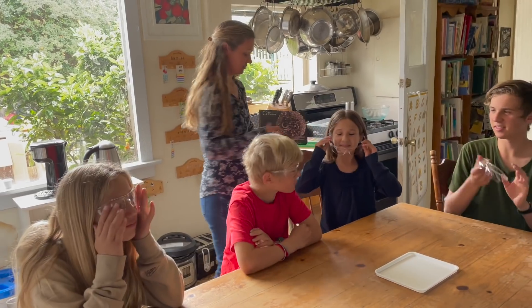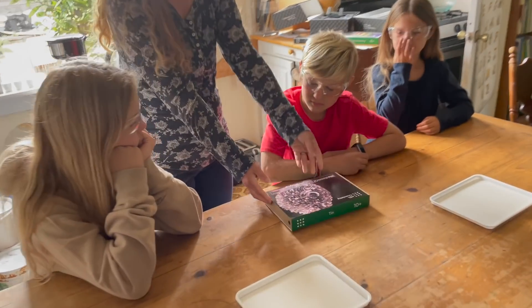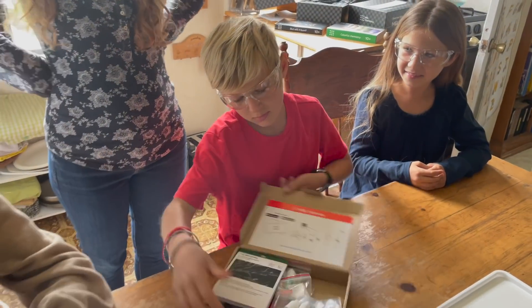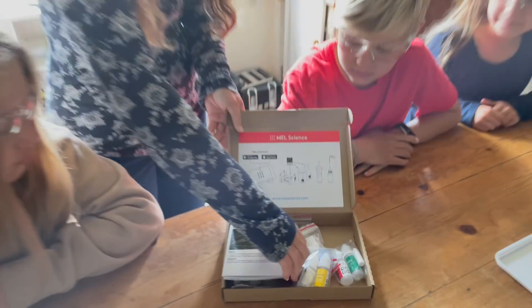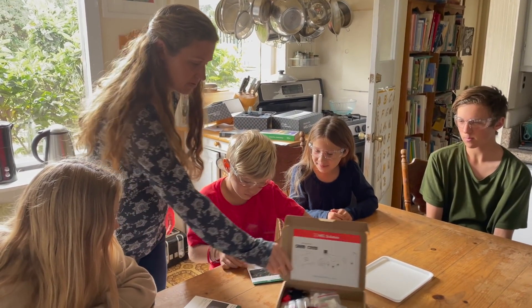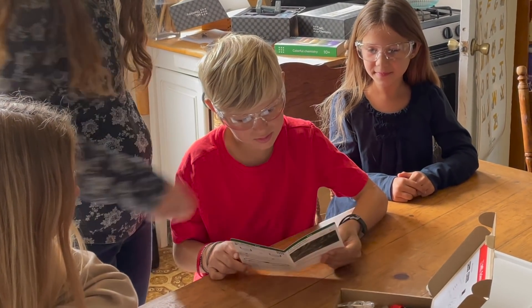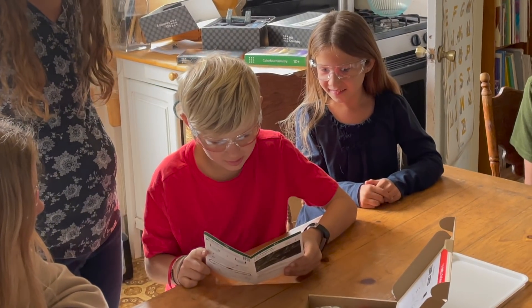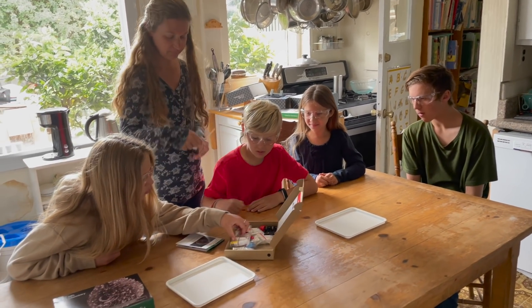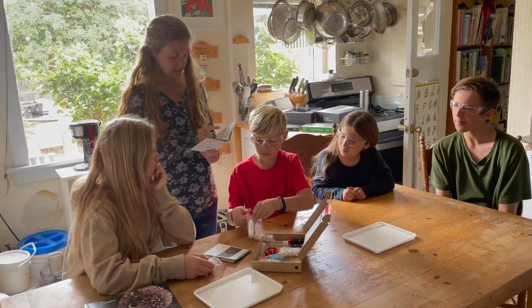Alright, so we're doing tin first. I'm gonna open that. Each set comes with multiple experiments. Okay, so we're gonna start with this one — tin dendrite. Alright, you can be the first person to read: 'A metal tree grows before your very own eyes.' First, prepare the tin chloride SNCl2 solution. Okay, so let's find that. What does it look like? It's gonna be a green bottle. It says SNCl2.